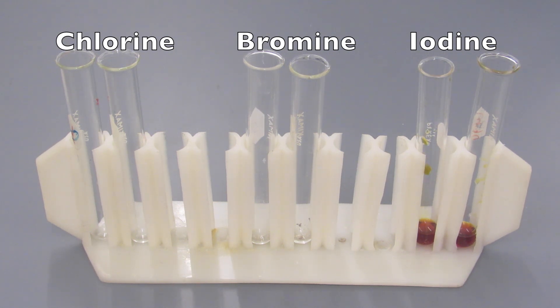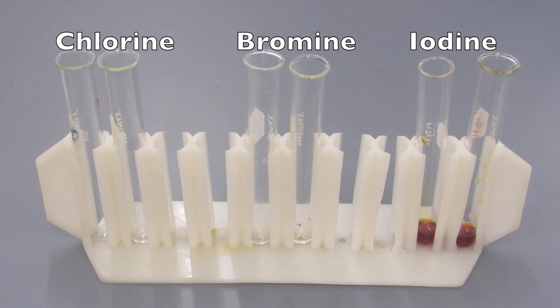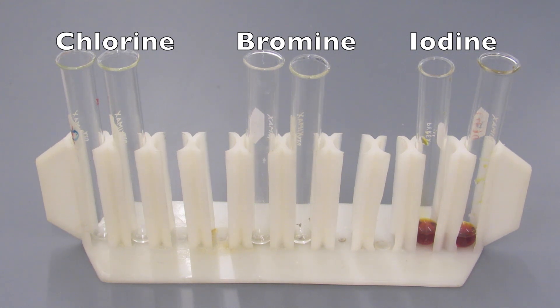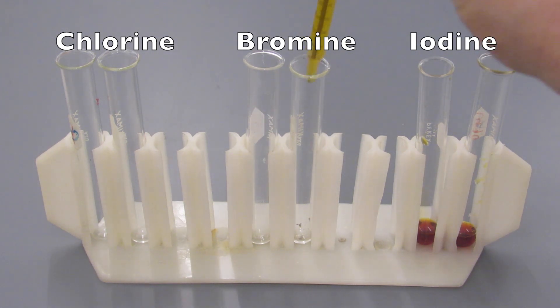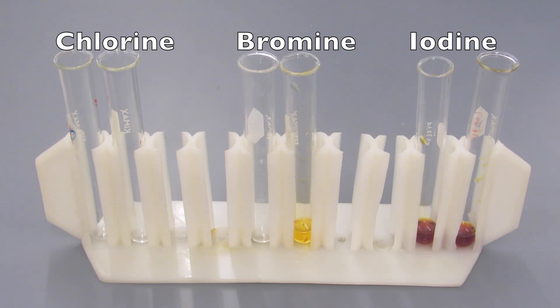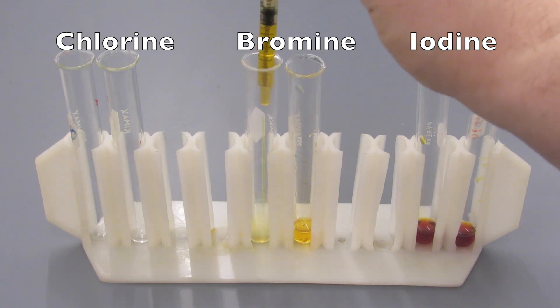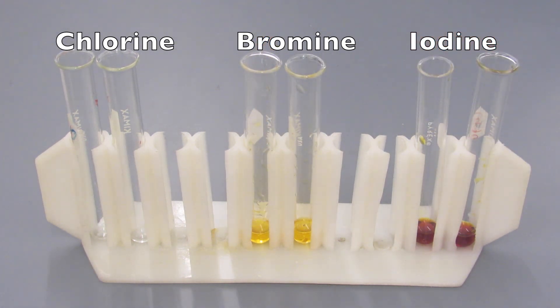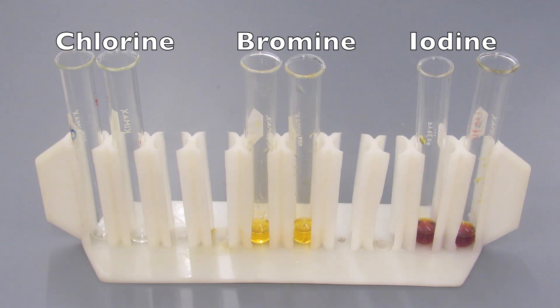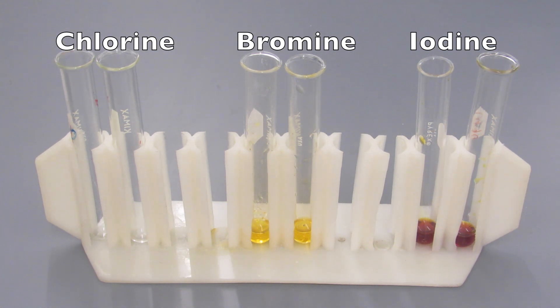We are going to test the reactivity of all of these elements by reacting them with the ionic form of the other corresponding elements. For example, we're going to react chlorine or Cl2 with sodium bromide and sodium iodide. We're going to react bromine with the corresponding chloride and iodide, and then iodine with the corresponding chloride and bromide, to see which one is the most reactive.